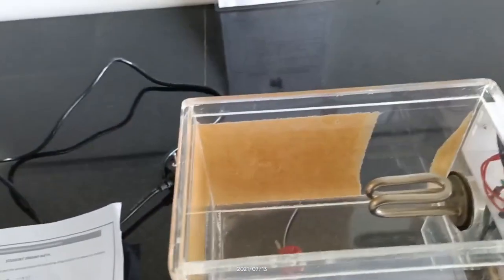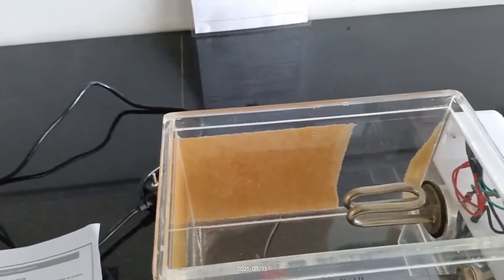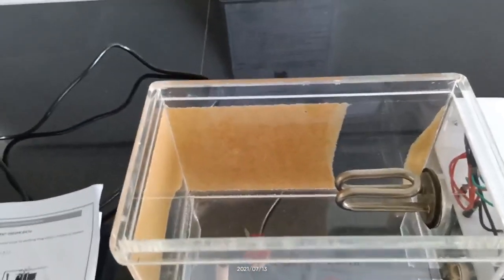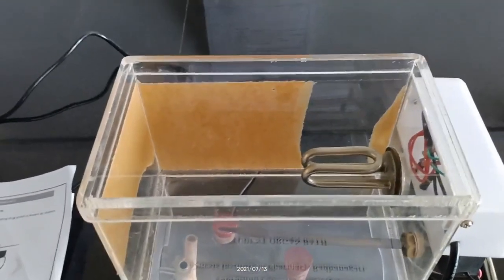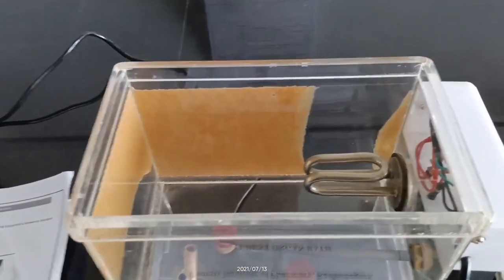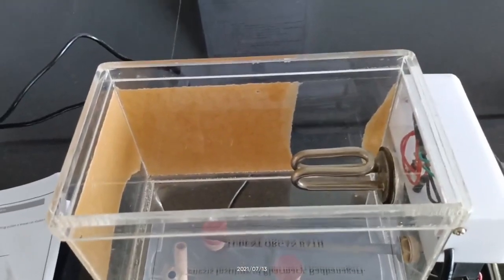The next part is the organ tube. This is a type of test tube used as an organ tube, and it is used to hold the tissue.